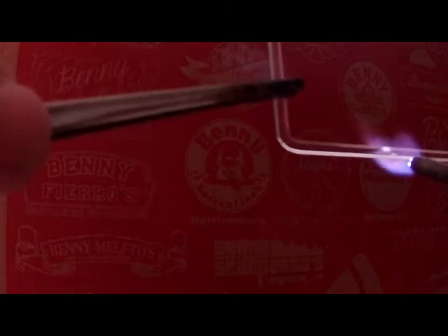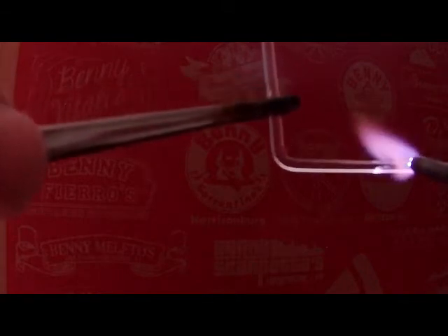So what I'm going to do now is just give a very quick demo of that. So I've taken the borosilicate rod and bent it, and what I'm going to do, and I'm eyeballing it now, I could try and measure this a little bit better, is I'm essentially going to make a square. So heating that up.